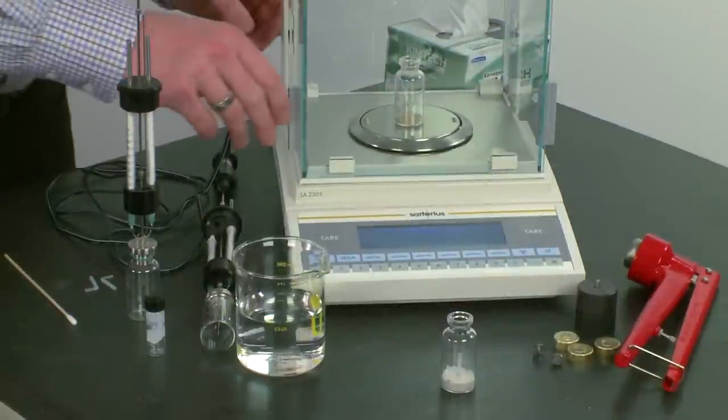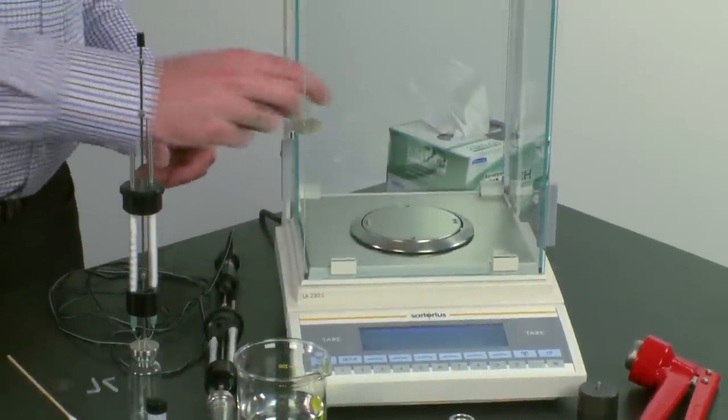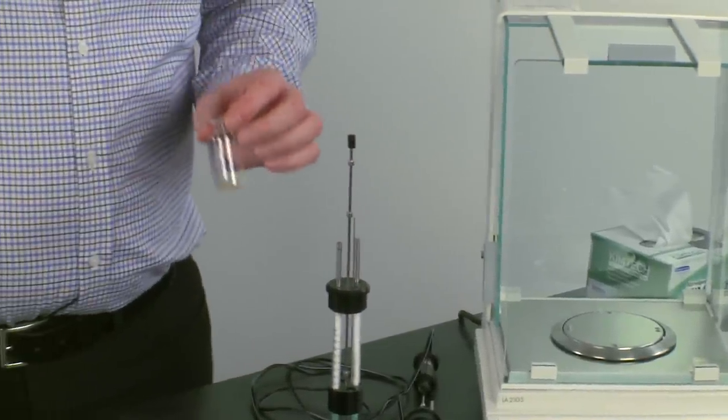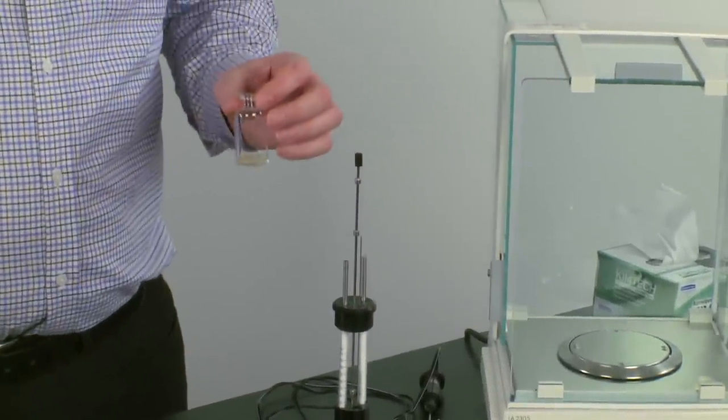The next step, which we won't show in detail, is to prepare the amount of cement you're going to use with the AdMix ampoule.